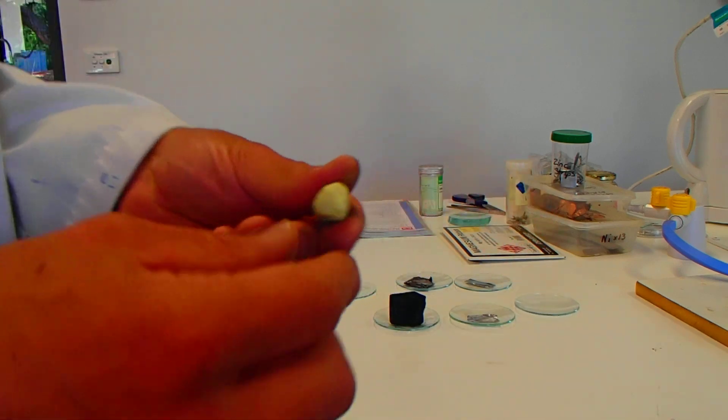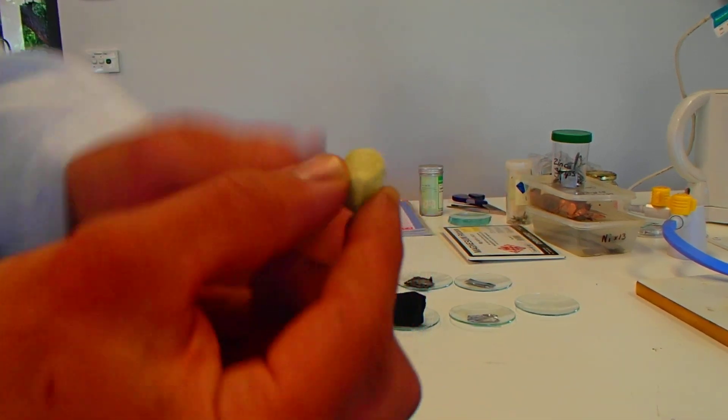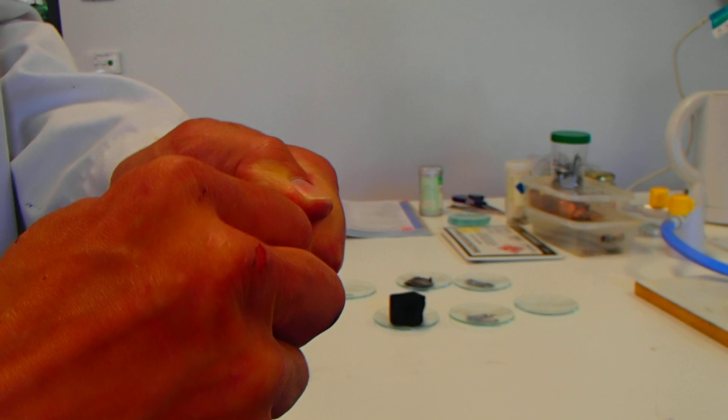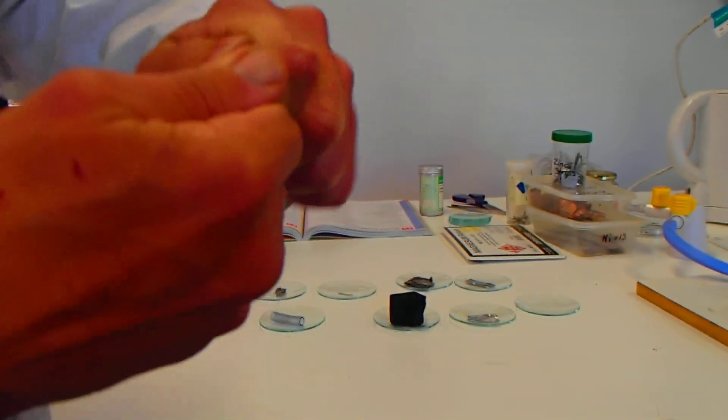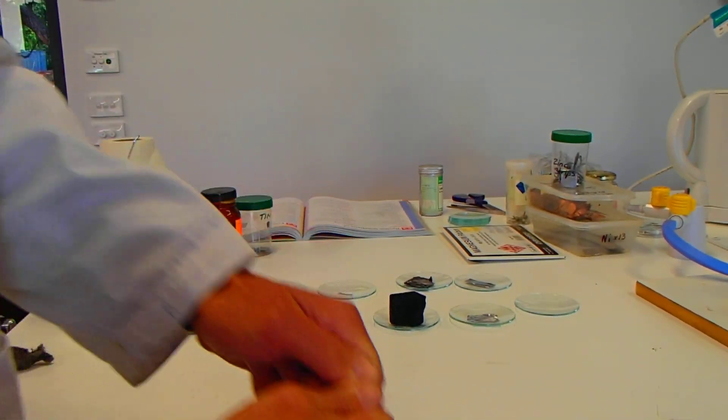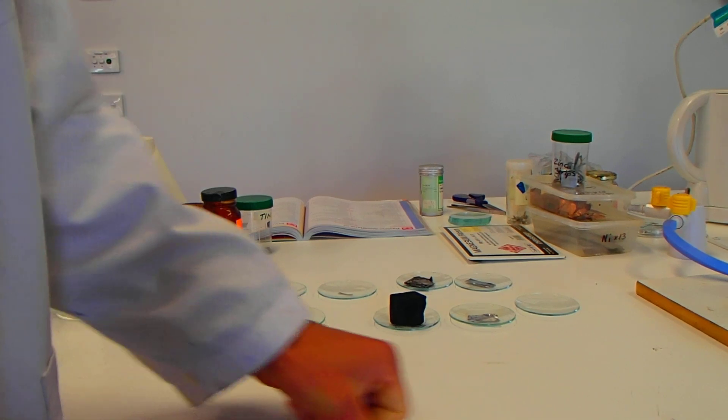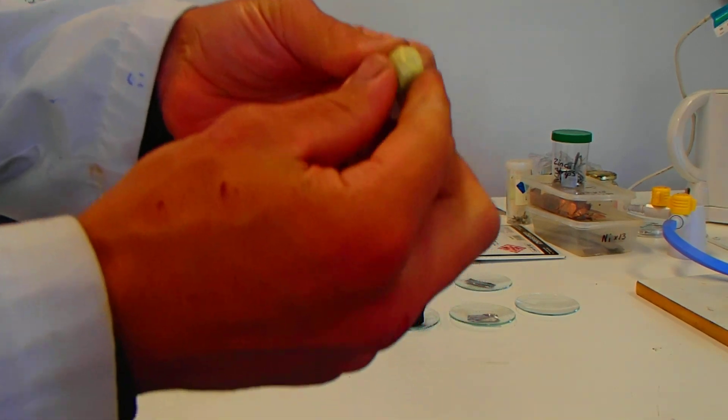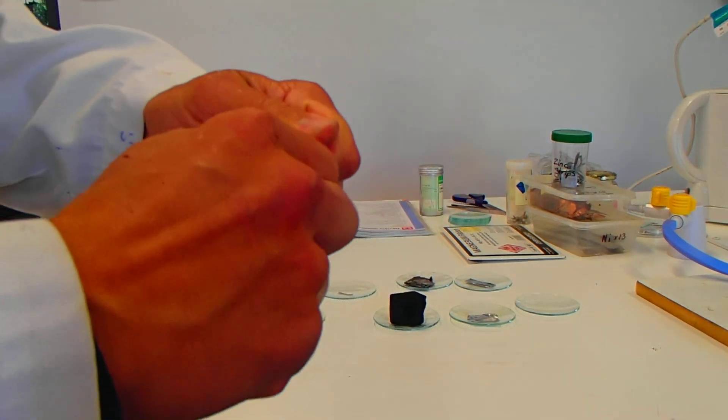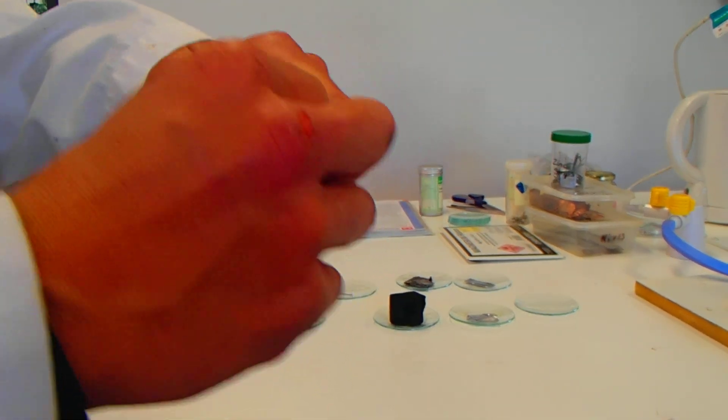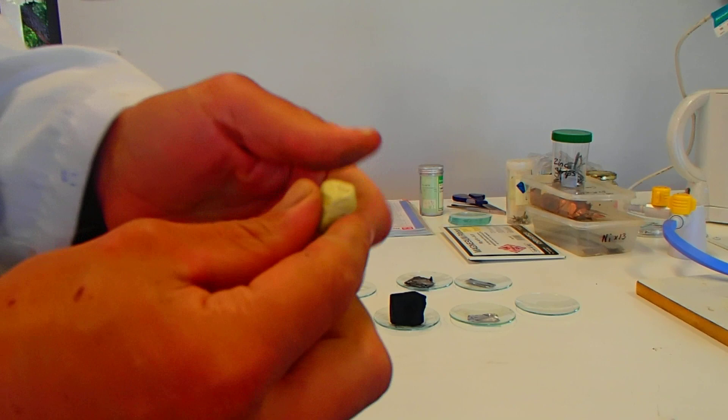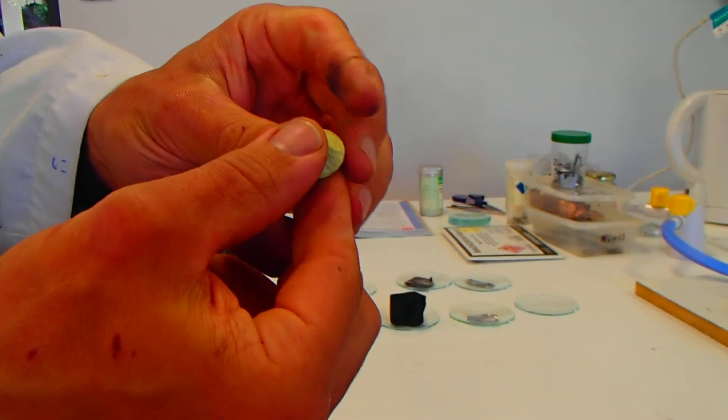So what happens when I get the sulfur? This is the sulfur sample. That's quite strong. I can't bend it. I can't even crumble that. I feel like I could break it a little bit. There's definitely some coming off in my fingers, but that is quite tough, quite strong. Crumbly, if anything, but won't break, won't bend. So that's the sulfur sample.